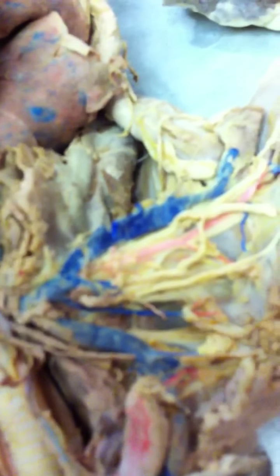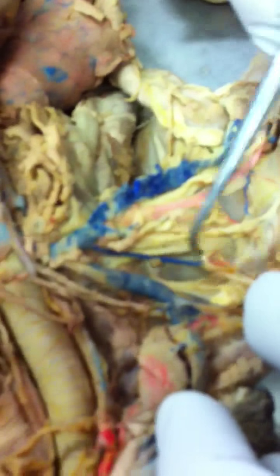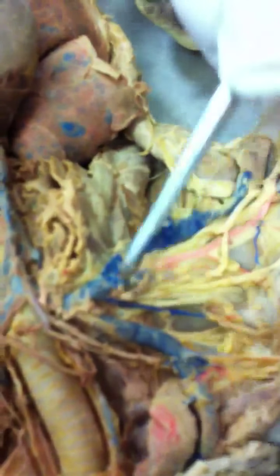The subscapular artery. This is the subscapular vein right here, and the artery runs with it. So let's see. Here's the subscapular vein on this side, and you can find the artery running with it if it's there. I don't see it here. The injection probably wasn't good, or it's been torn. Let's take a look on the next one. Yeah, they run together. Now the subscapular artery comes off at different places in different cats. But you look for something running right along with the vein going back to the scapula, and I don't see it on either side here.